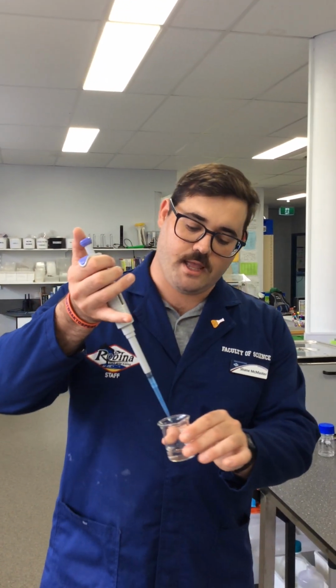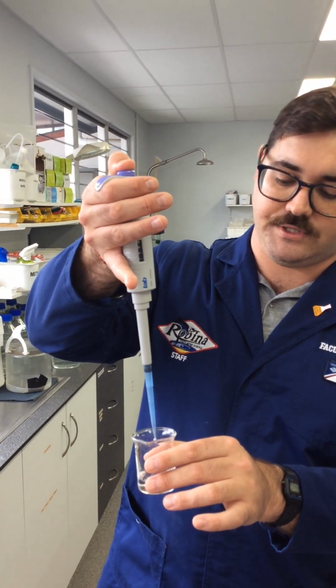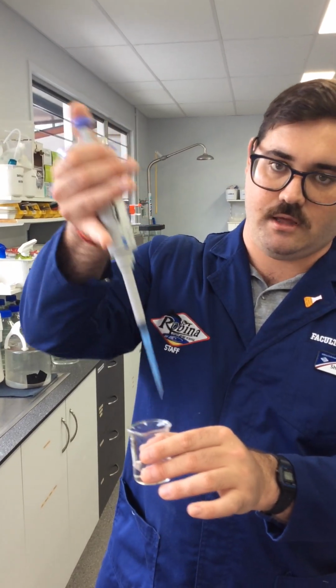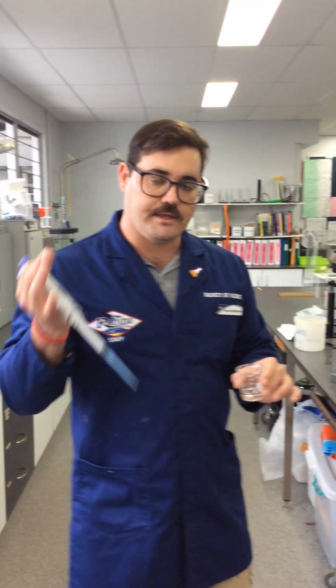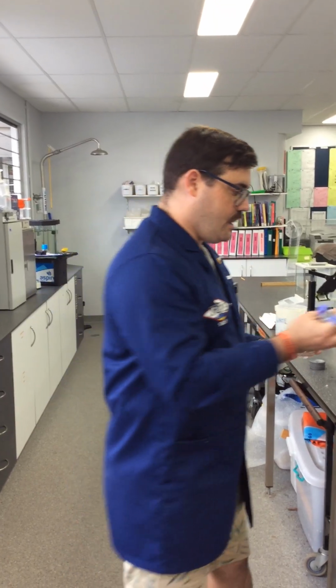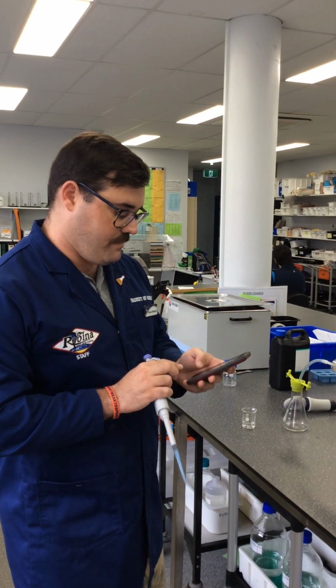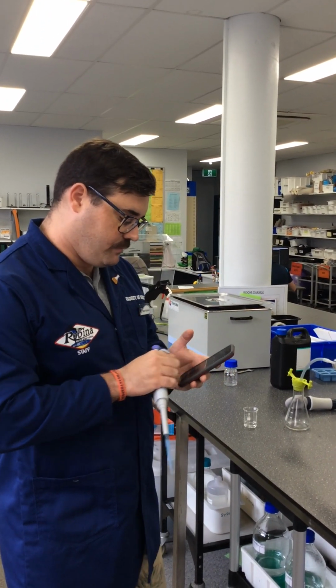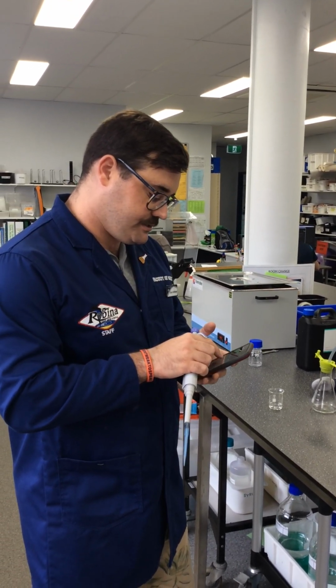Then when I want to get rid of it, you just push all the way down to the second stop and release. That's how we get rid of it. Now, what I'm going to do, and this is going to happen quite quickly, is I'm going to take a sample with this. I'm going to squeeze it out into the flask, close the lid, and we're going to run it for 30 seconds and see how much oxygen or gas we make. So I'm just going to get a timer ready on my phone. We only want it for 30 seconds.